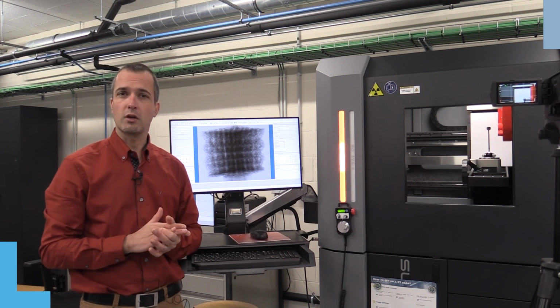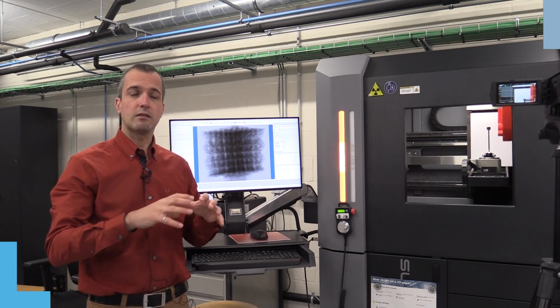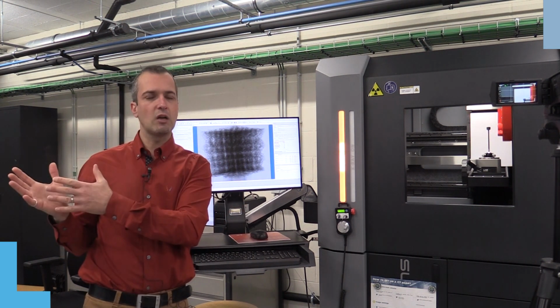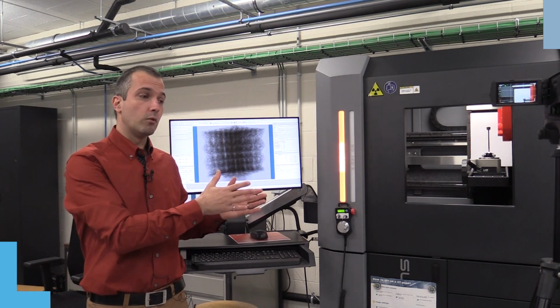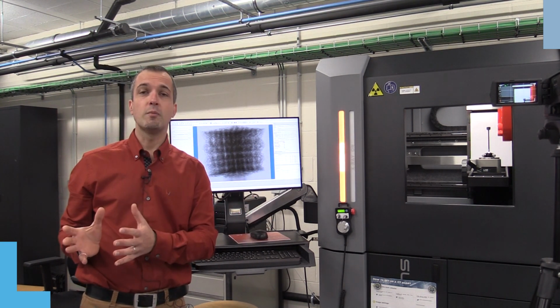using computer calculations. The typical applications for this type of instrument are looking at structures, characterizing them in 3D, and linking the geometry to their mechanical properties. In terms of materials, we can go from looking at bone structures to 3D printed elements or bulk materials.